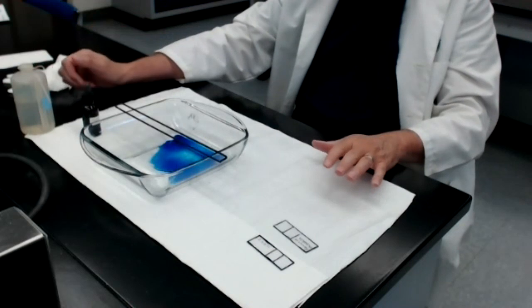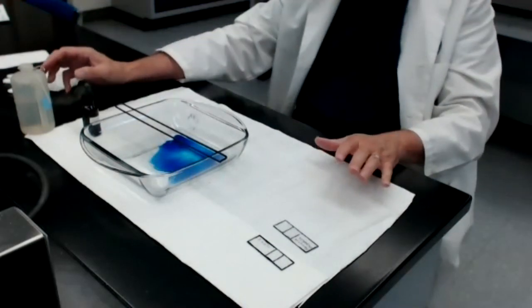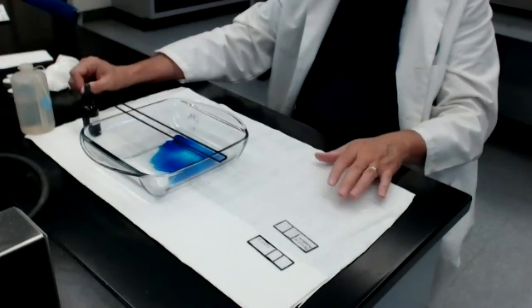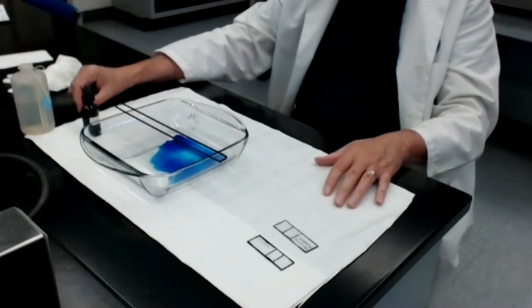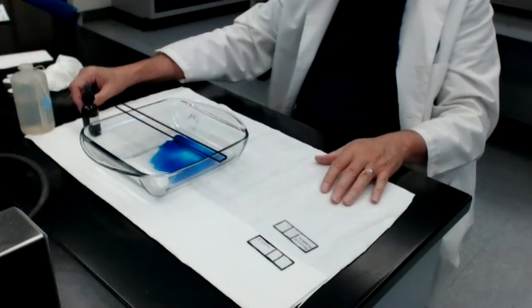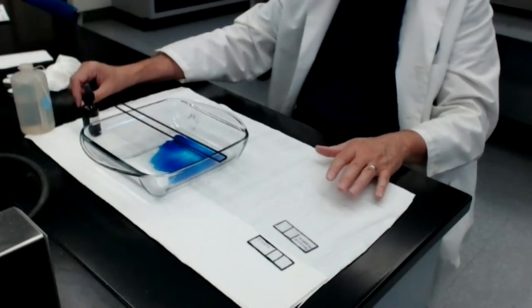You just use whatever works best. Again, I normally don't do staining without gloves, primarily because I don't want to get the stain on my fingers. But if you were working in the lab, you might have the option of either using gloves or using some sort of slide holder to move the slides around.